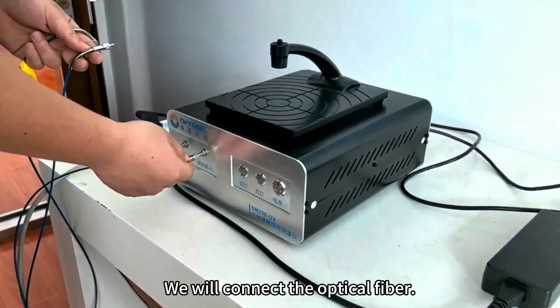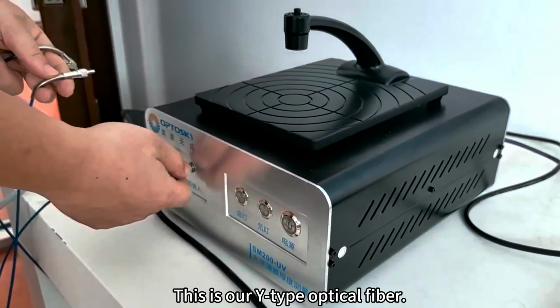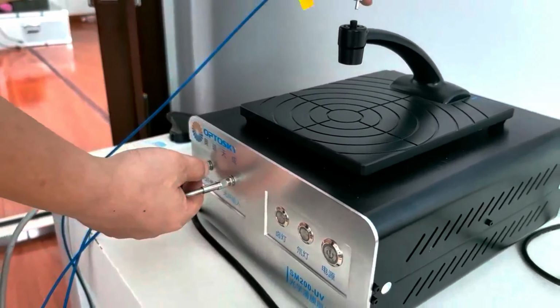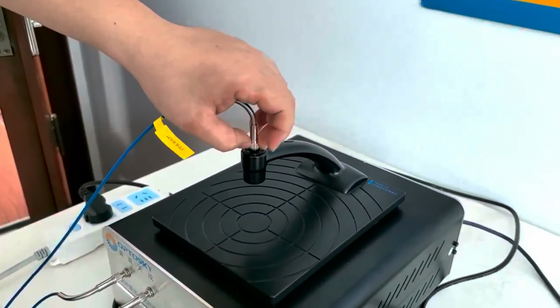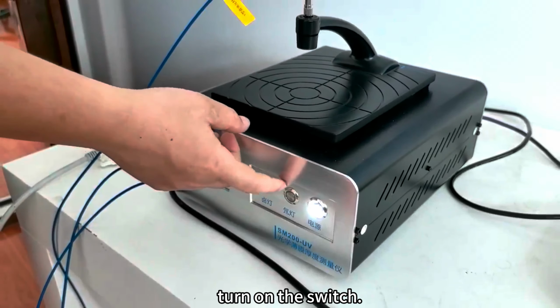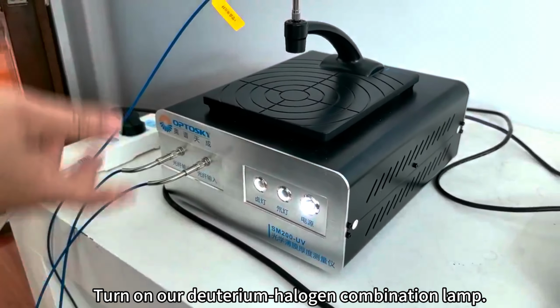We will connect the optical fiber. This is our Y-type optical fiber. Connect power. After connecting the optical fiber and power, turn on the switch, turn on our deuterium-halogen combination lamp.